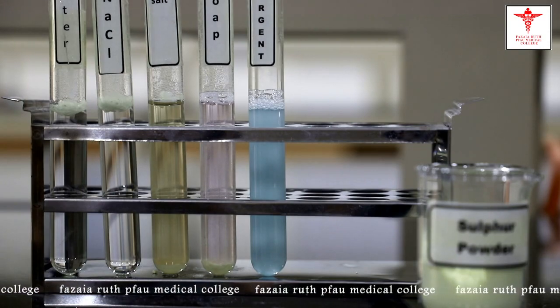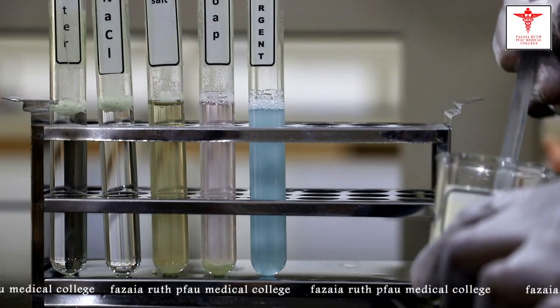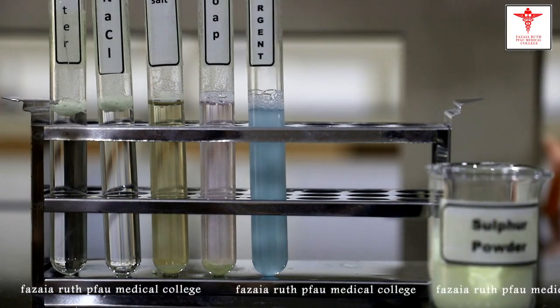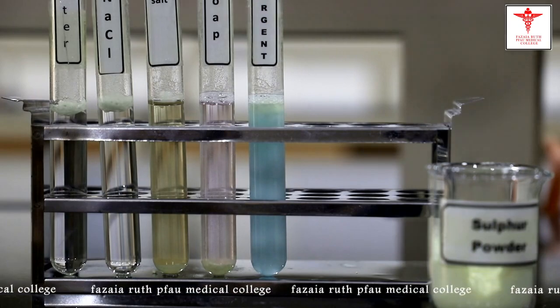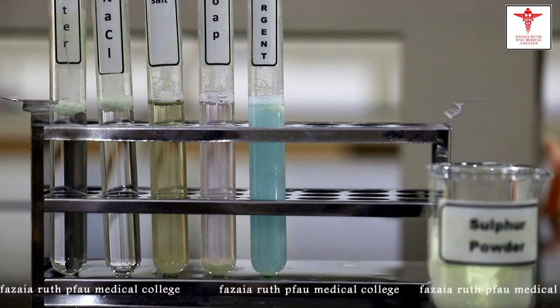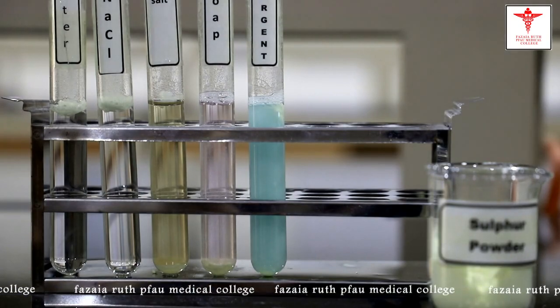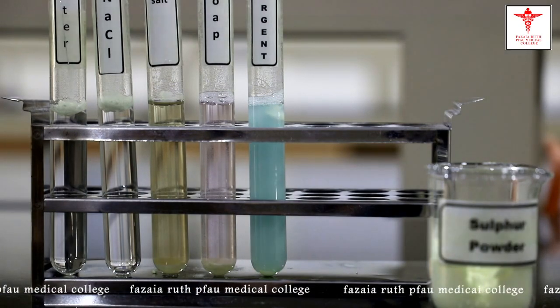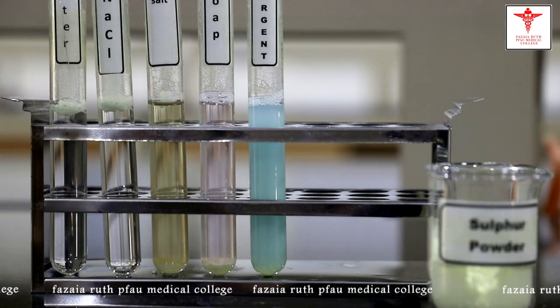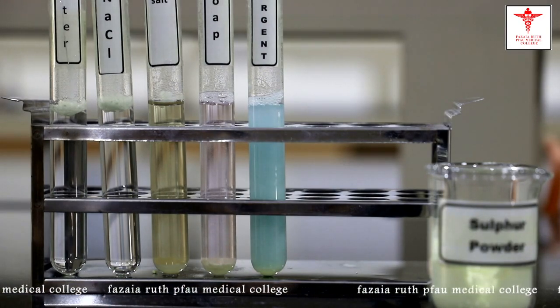Okay, we'll add sulfur powder to the fifth test tube, which contains a detergent solution. Similar to the previous two solutions, it also has a lower surface tension. That is why the powder has settled down at the bottom.